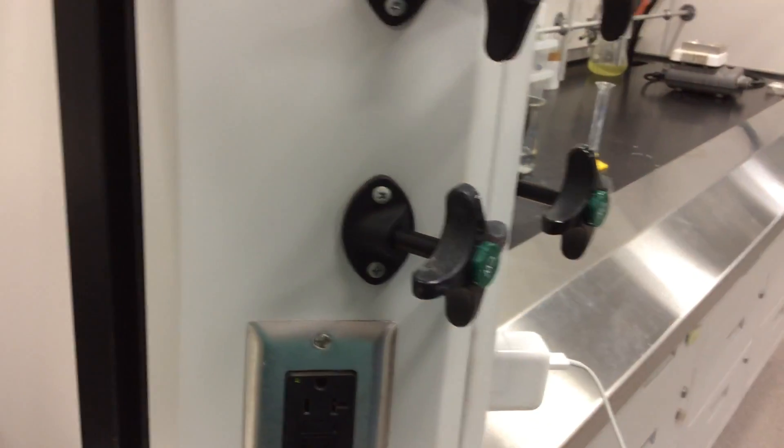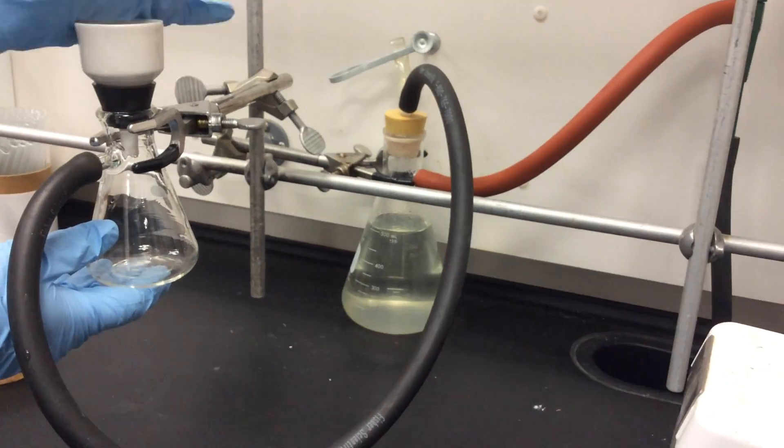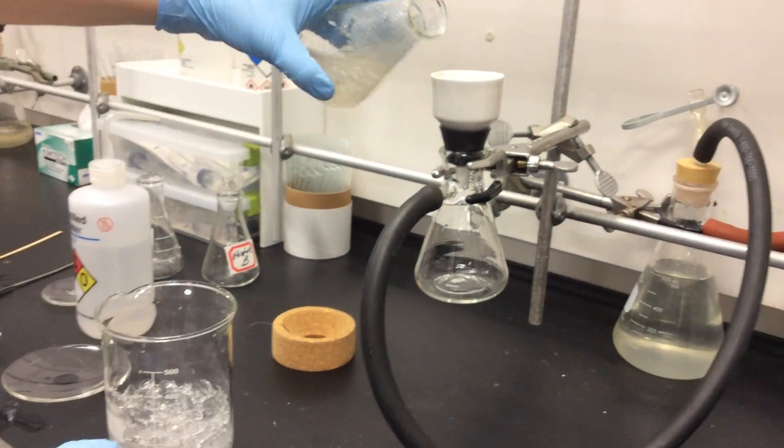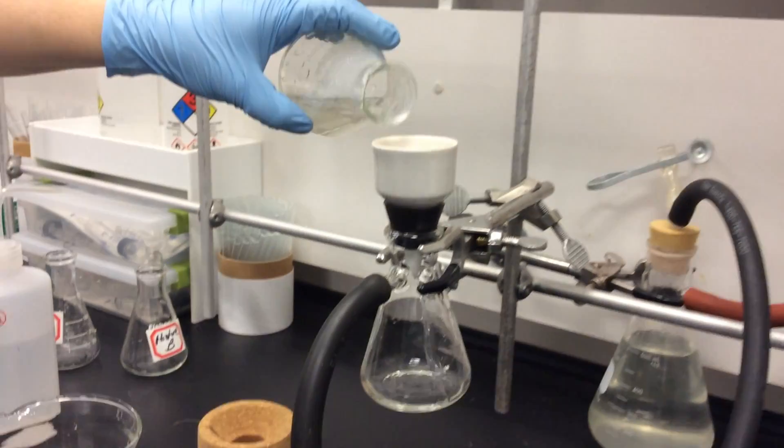We have our vacuum filtration already set up. We turn on the water. Once the water's turned on and suction is happening, all we do is filter.